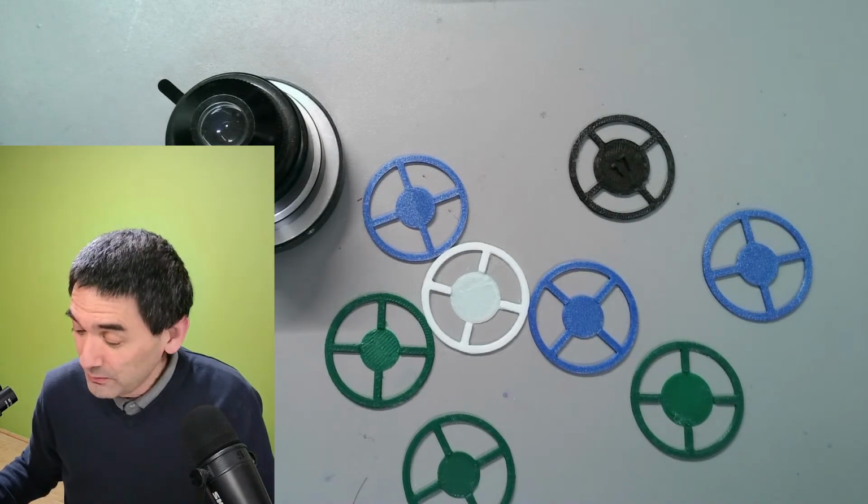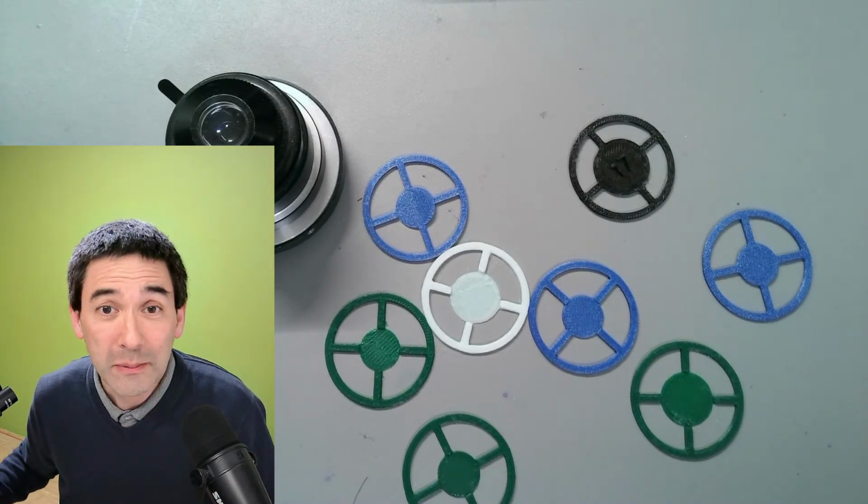It's a special request video, a little bit, because last week somebody requested, can you talk about oblique illumination a little bit? Now, this is not a new topic, and oblique illumination is not a new concept. It goes all the way back to the beginning of microscopy. I read somewhere that even in the 1800s, when folks started to observe bacteria under the microscope, very difficult objects to see, they used oblique illumination to increase the contrast.